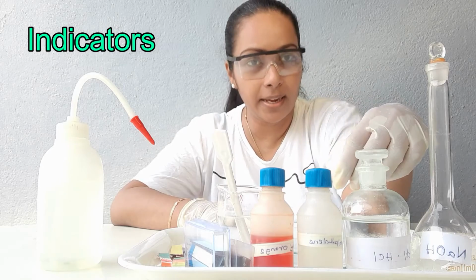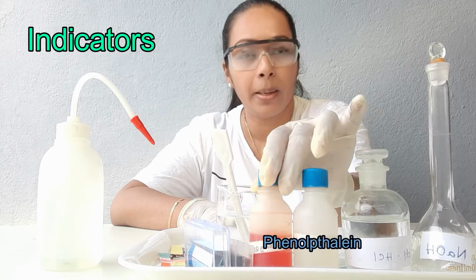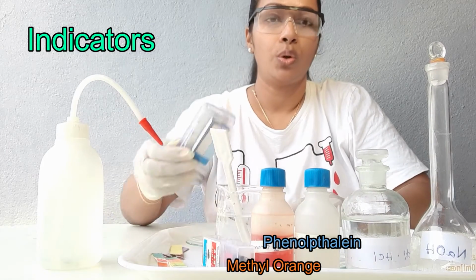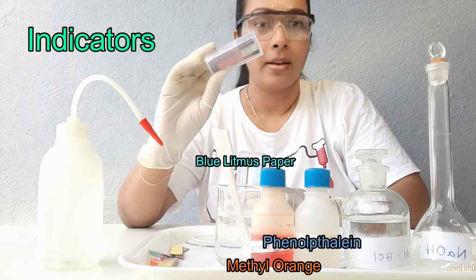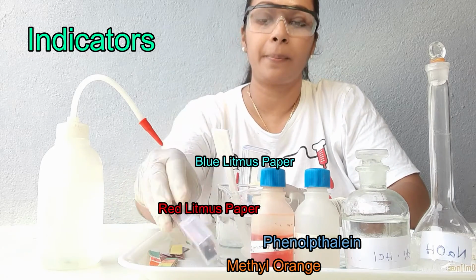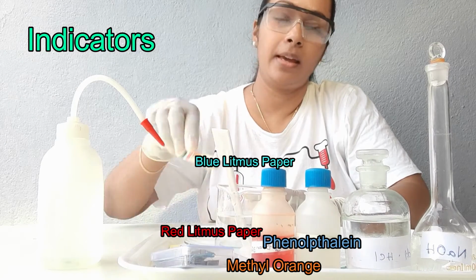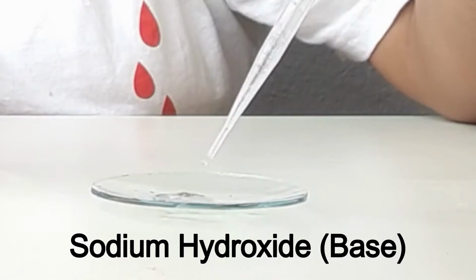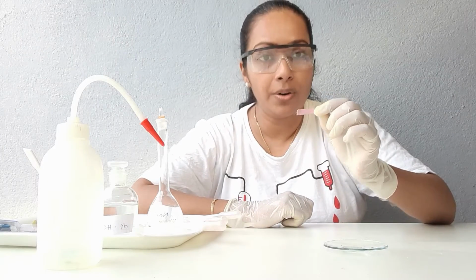As indicators I have taken phenolphthalein, methyl orange, blue litmus papers, red litmus papers, and pH papers.